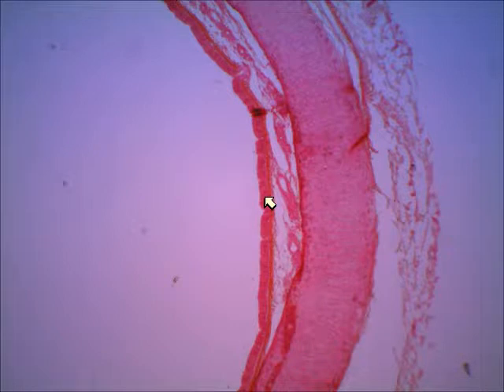Then just lining that is the epithelial layer, and you learned in your lecture that the trachea is lined with ciliated pseudostratified columnar epithelium. Of course, on this view, you can't see the cilia well, so we'll see that when we get to the higher powers. But you can see the real thick ring of hyaline cartilage. It's not a continuous ring. It's not completely a closed circle of cartilage. It's more of a C-shaped ring, so it's open at the back of the trachea, which is good because the esophagus is just behind the trachea, and the cartilage then won't press into that. But we'll be looking at this also on a higher power.